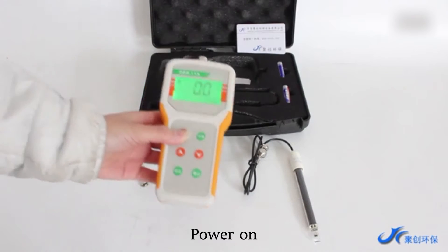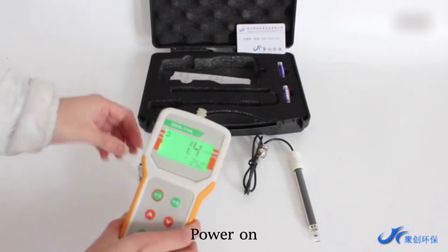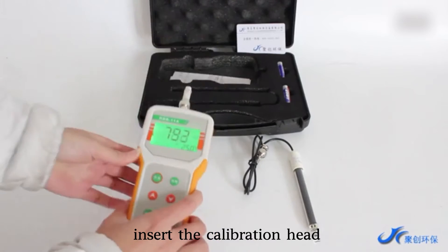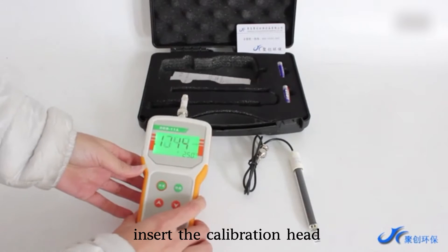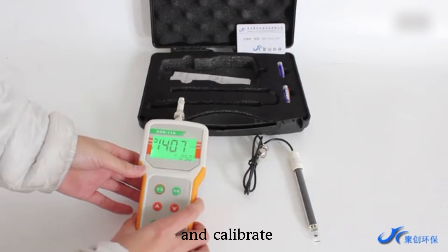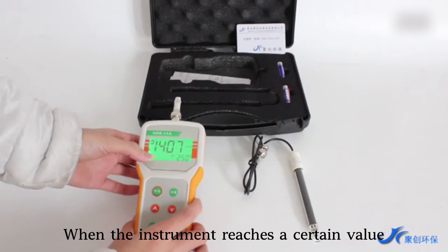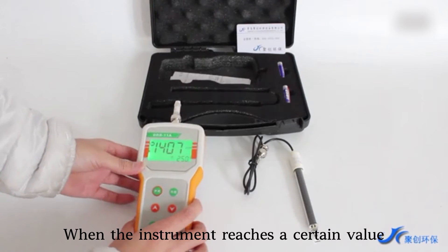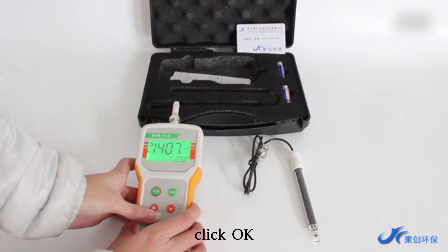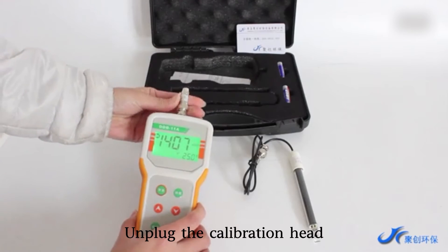Power on. Insert the calibration head and calibrate. When the instrument reaches a certain value, the calibration is completed. Click OK. Unplug the calibration head.